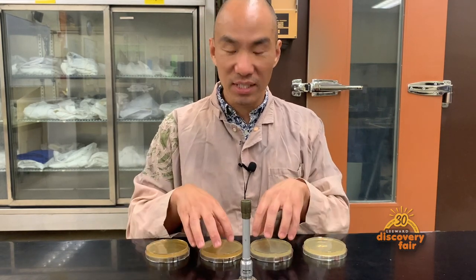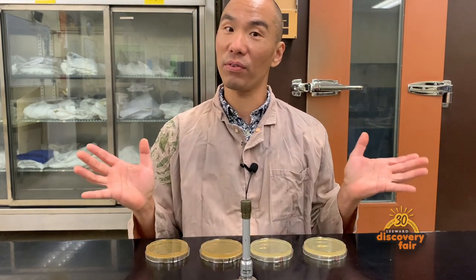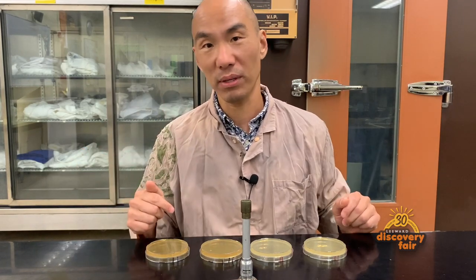We're going to stick these in the incubator, let them grow overnight, and then tomorrow I'll show you what happens.